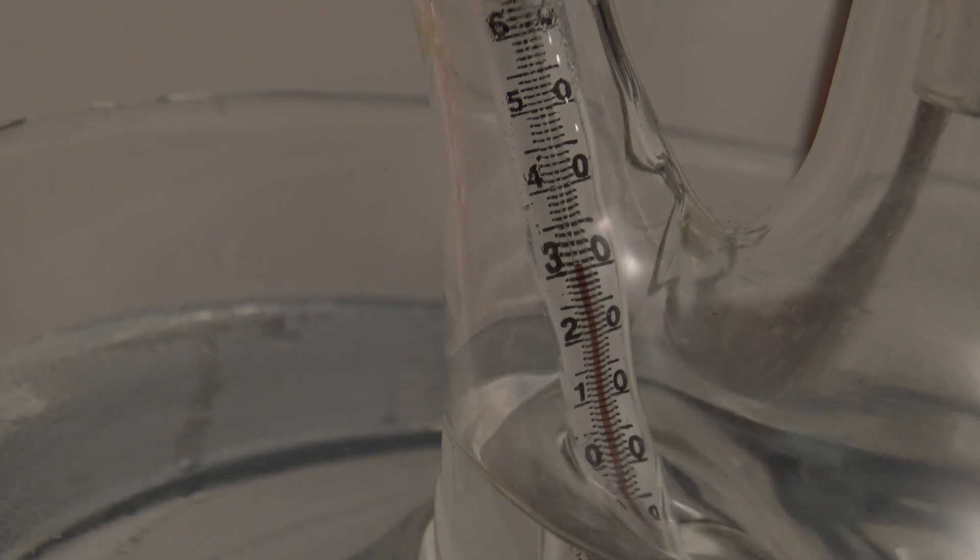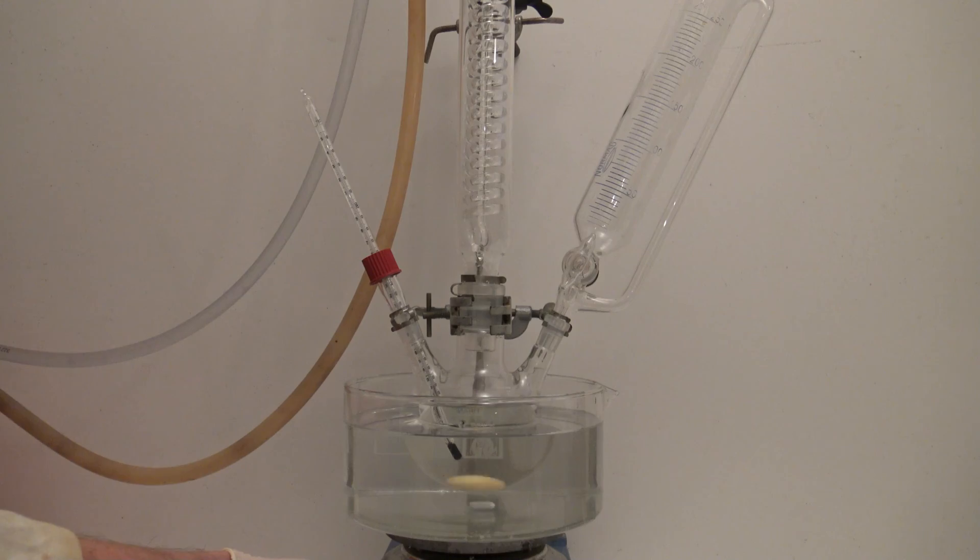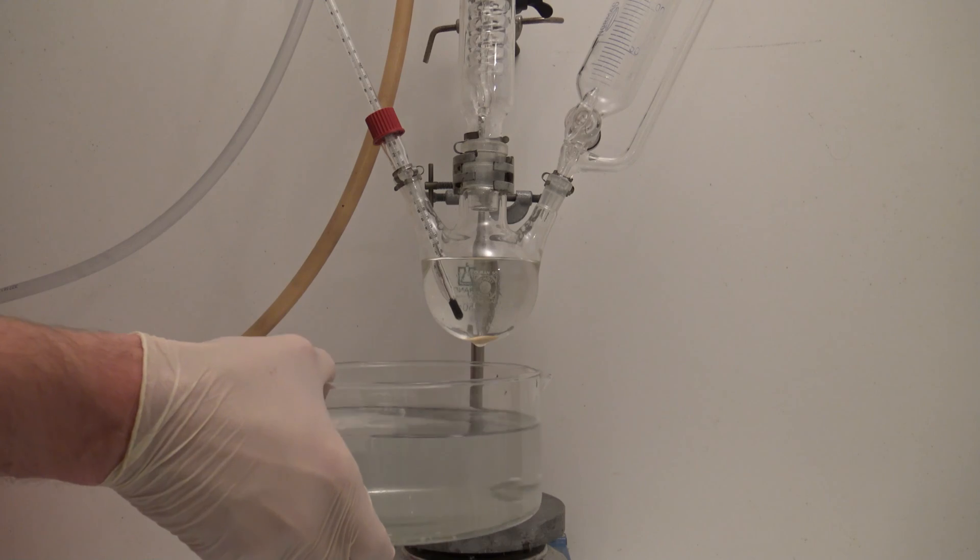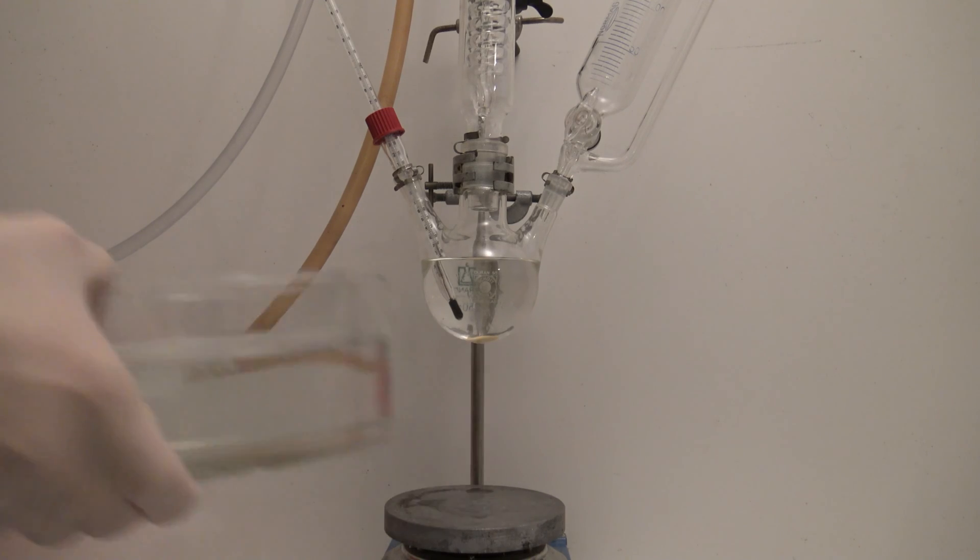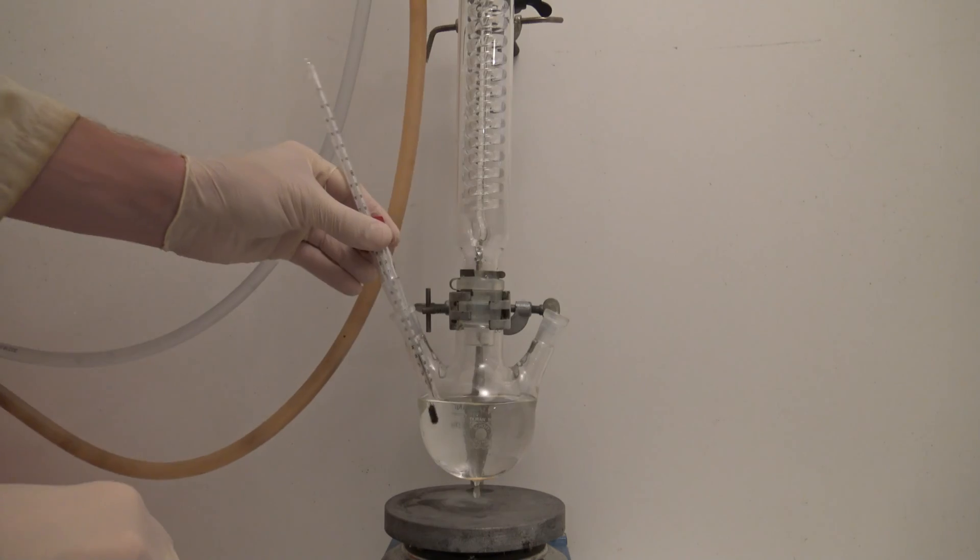At the end, the temperature was at 31 degrees C. This was way lower than the boiling point of methanol, so the apparatus was detached immediately and it was set up for simple distillation.